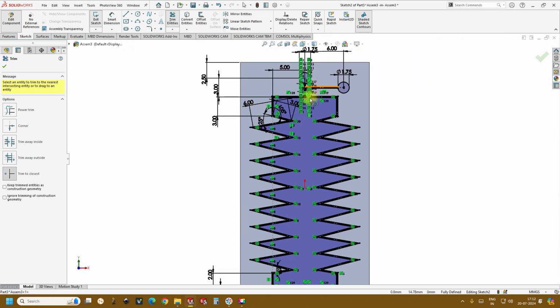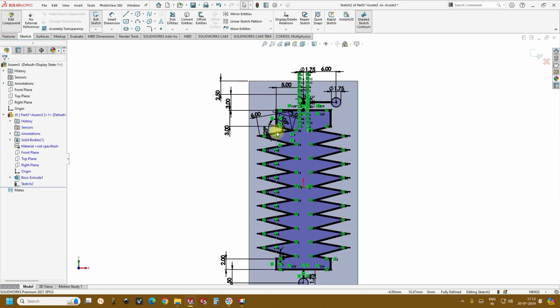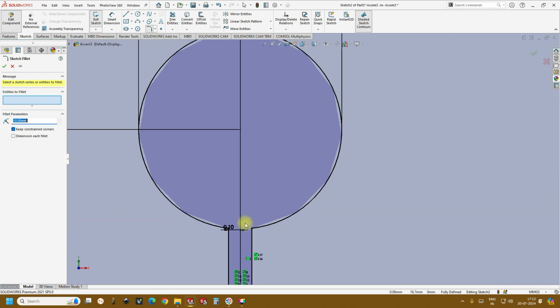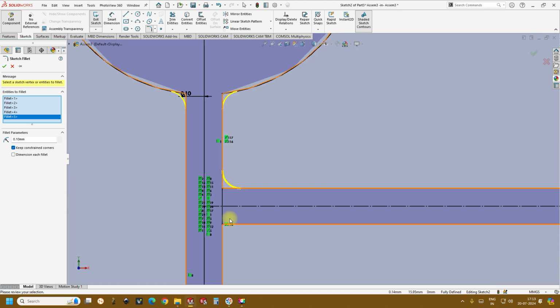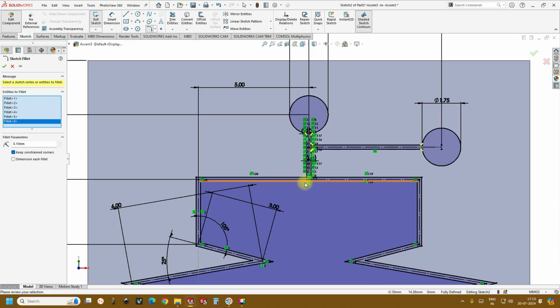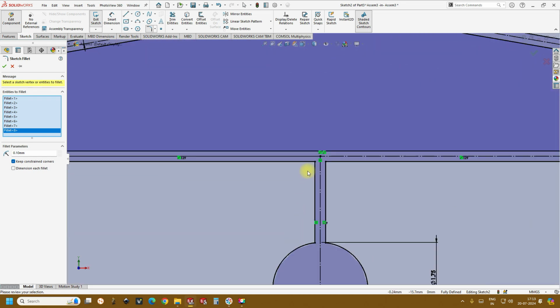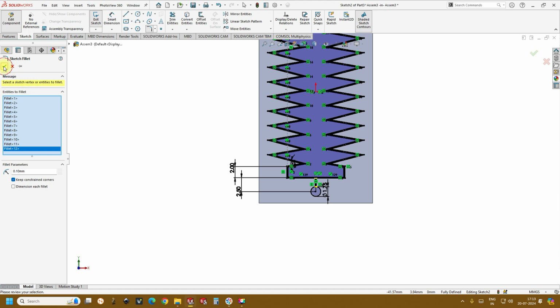So this is the important part of this session. These are the micro passages of 200 microns channel width. And for example, if you wanted to create a fillet over here, just create a fillet at the inlets. These are to avoid the stress, like these are the stress corners. Just to avoid that, just click OK.